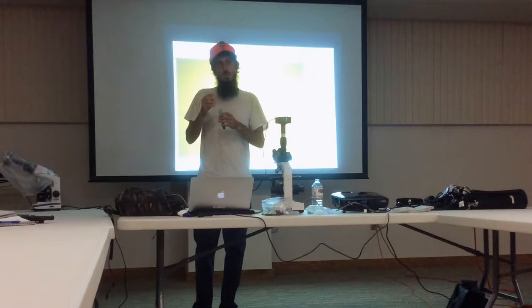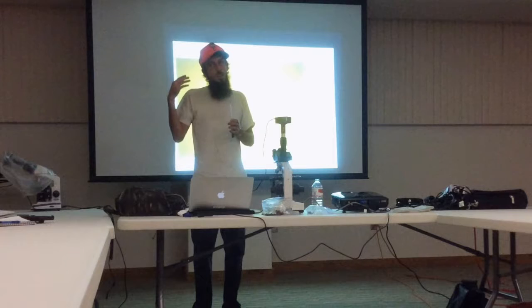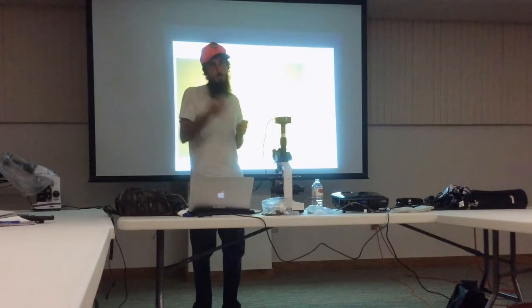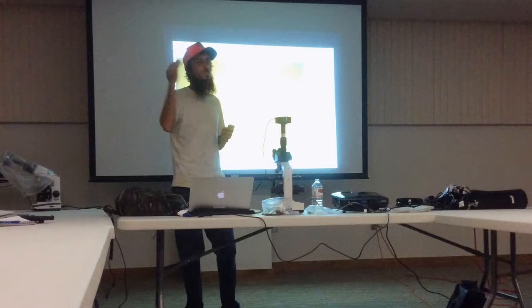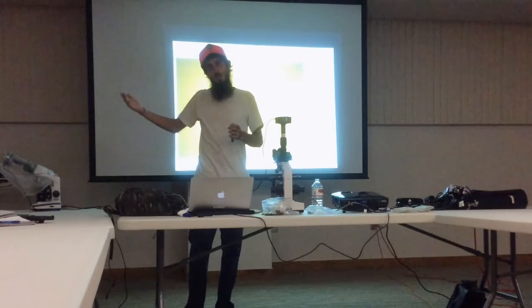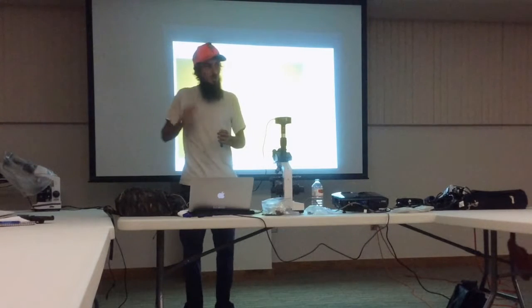This is what we found in this area, because just in our little conversation, I found out that she has never seen a flagellate, maybe she didn't know exactly what it was, but she'd never found one in all her samples, but she finds amoebas all the time. And I look at my samples, and I've seen a fair amount of flagellates, not a whole lot, but I've seen them, but I've never seen an amoeba.